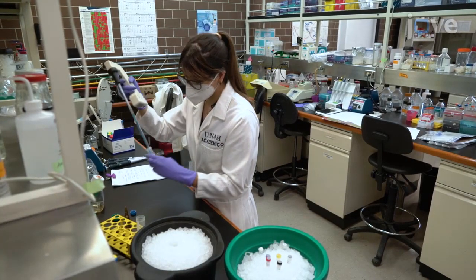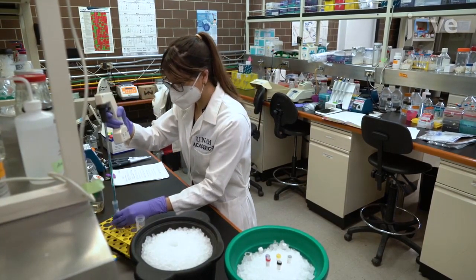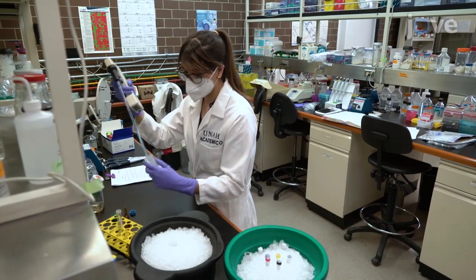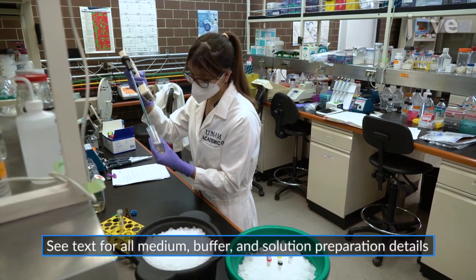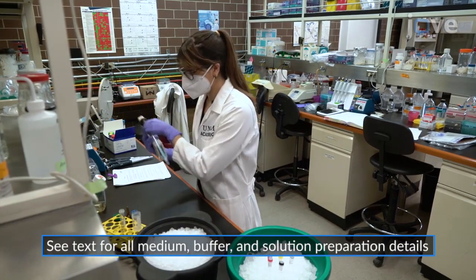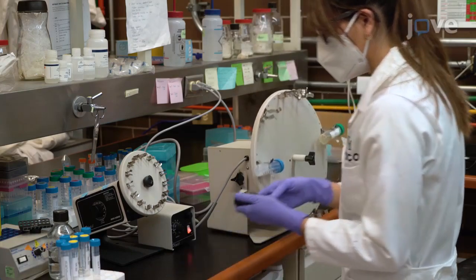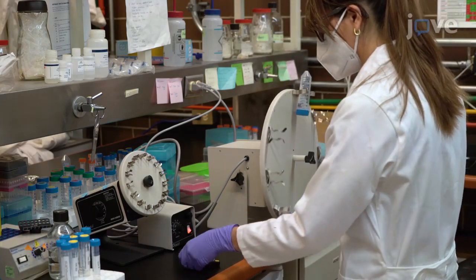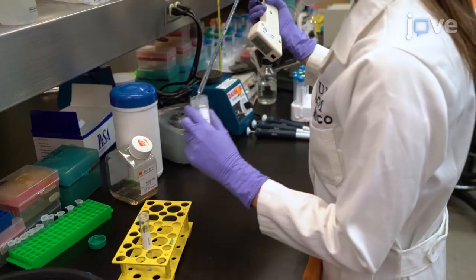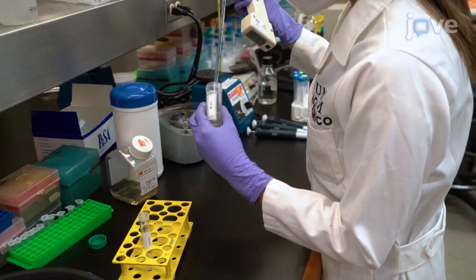Begin by adding methanol-free formaldehyde to 1 × 10⁷ Schneider's line 2 plus Drosophila cells in 17.5 milliliters of Schneider medium supplemented with 10% FBS to a final concentration of 2%. Incubate the cells for 10 minutes at room temperature with mixing every 60 seconds or on a rotating wheel, and add glycine to a final concentration of 0.125 molar with mixing.